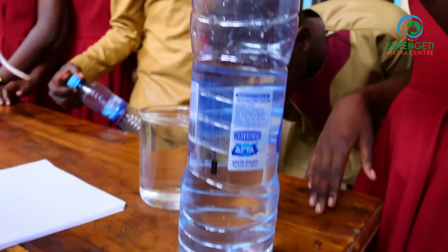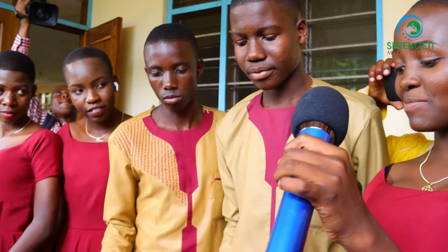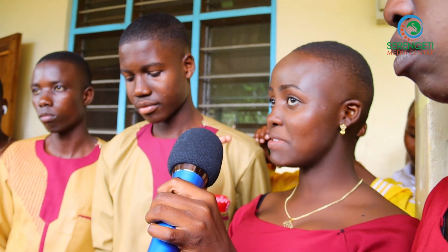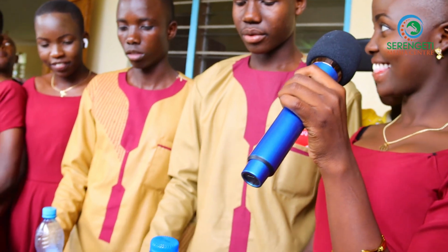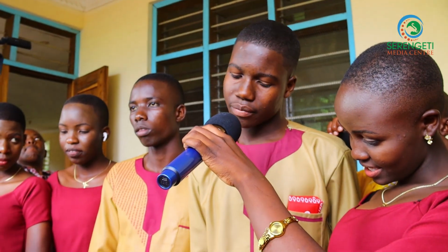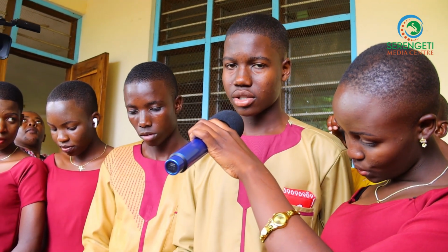So this is called an invisible fire because the fire produced here is not going to be seen by normal eyes. It's moving, as he has done. So how do you learn from this? We can use it to prepare home heating substance for domestic and industrial uses.